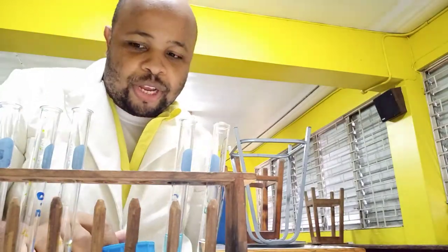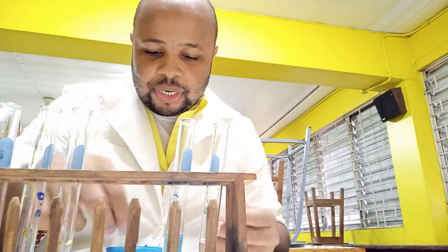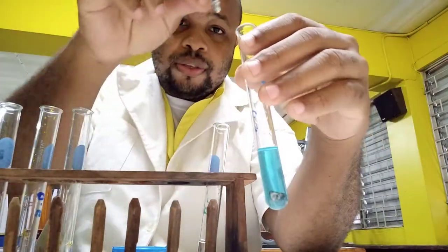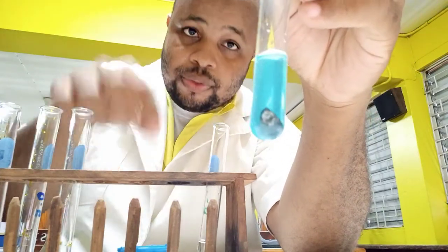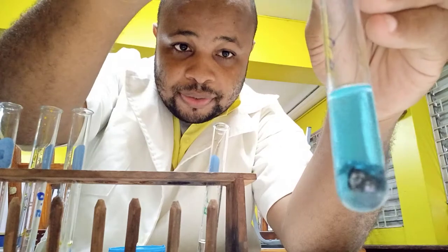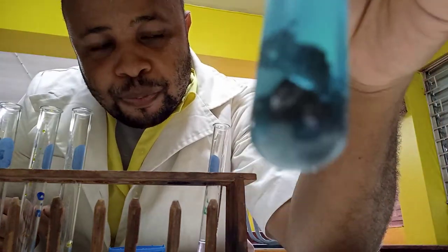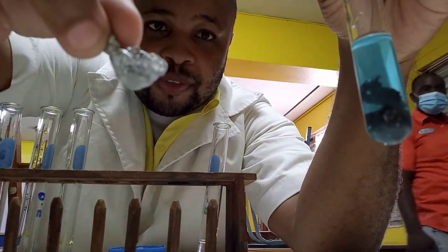If a redox reaction takes place, we are going to see some visible change — most instances it will be a color change. I'm going to add zinc metal to the copper sulfate. You can notice if you see anything occurring with the zinc — it's not completely gray anymore.